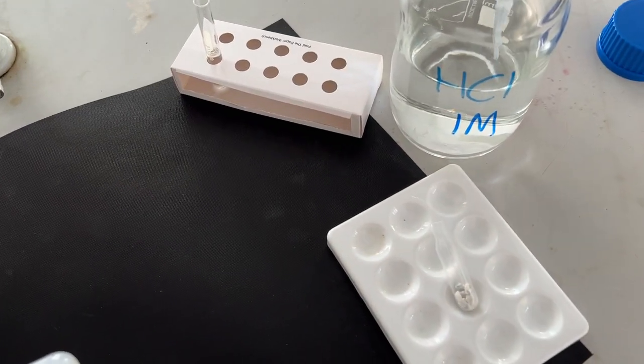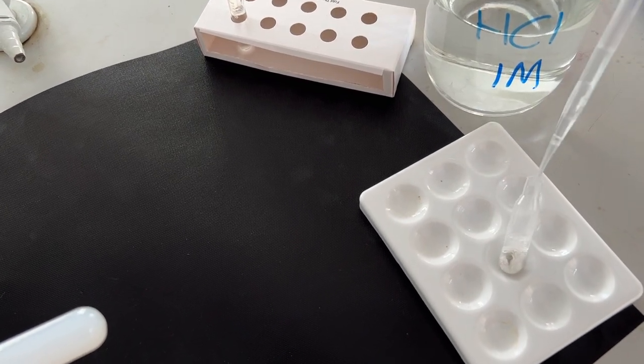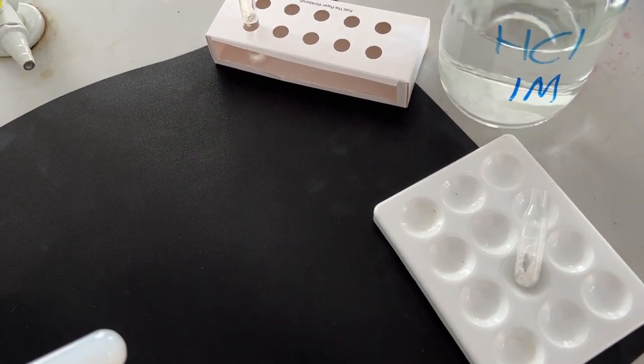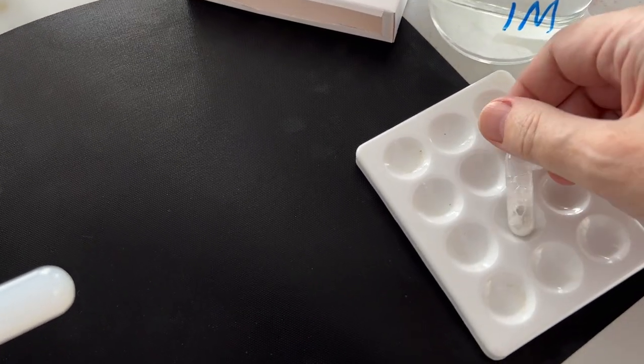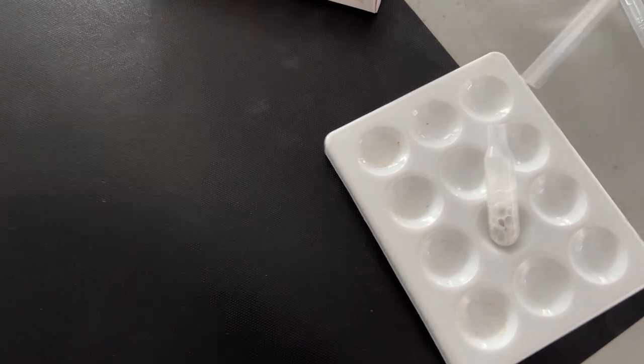Let's add the acid in. It goes - you may have noticed the vigorous reaction. This time we're going to sample the gas.